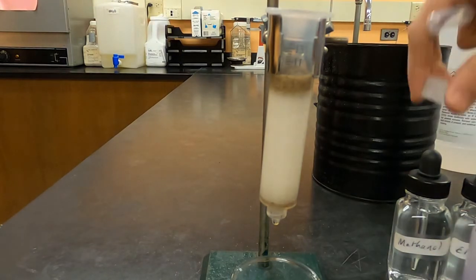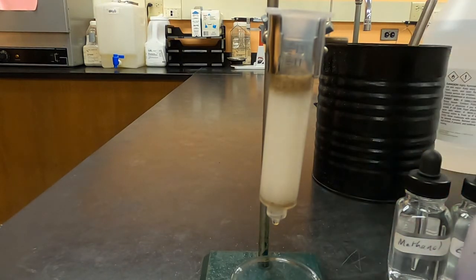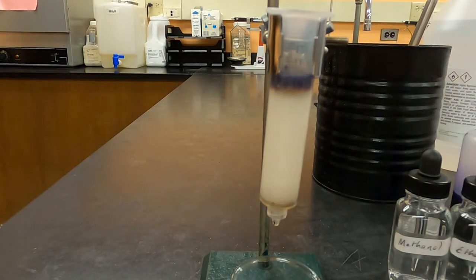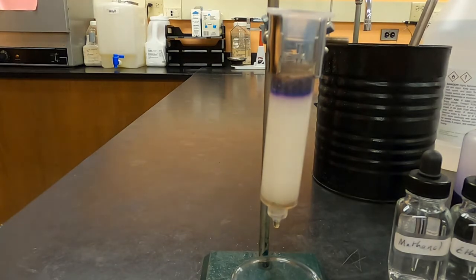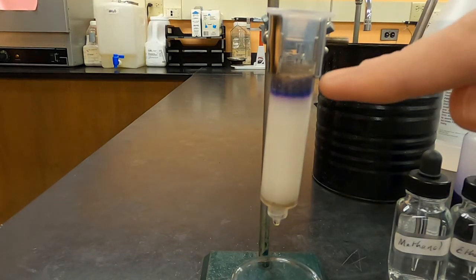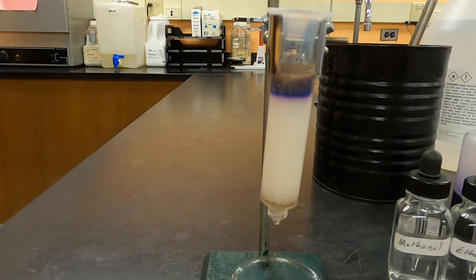You would apply your mixture, a few drops in the top. After it soaks into the sand, you add a few drops of your base solvent to get it into the packing material. When performing column chromatography, it's best to have only a thin layer of solvent at the top, but you do always want to have some at the top. You never want this to dry out. It can interfere with the flow of the mixture through the substances.